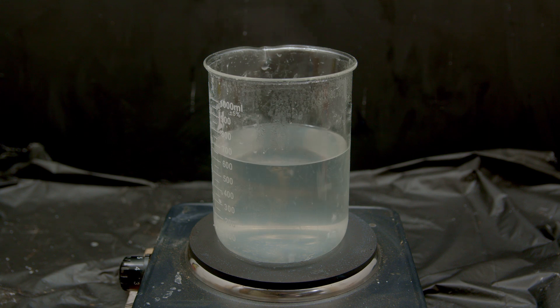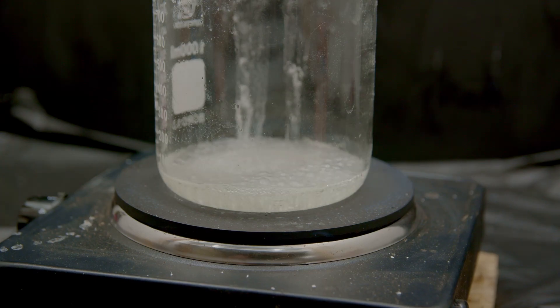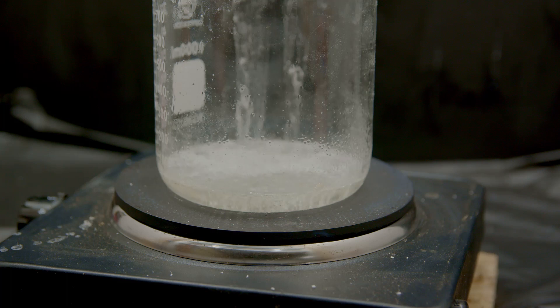So now that we have sodium acetate salt water, we can boil off all the water and we should just be left with the sodium acetate.